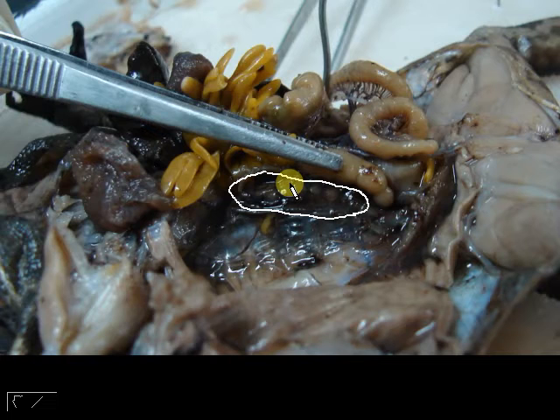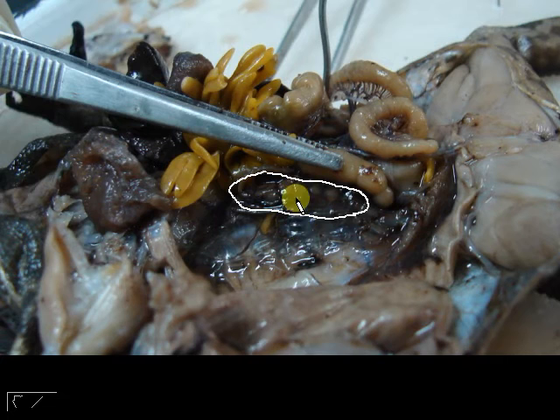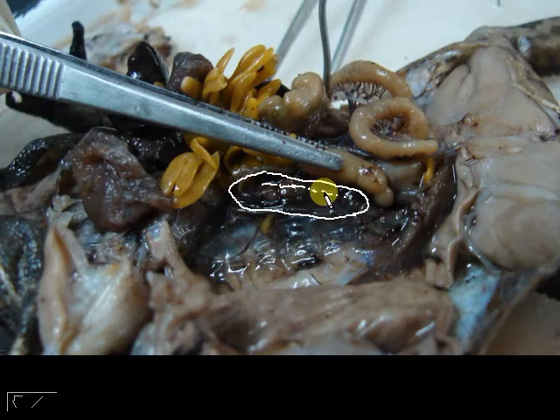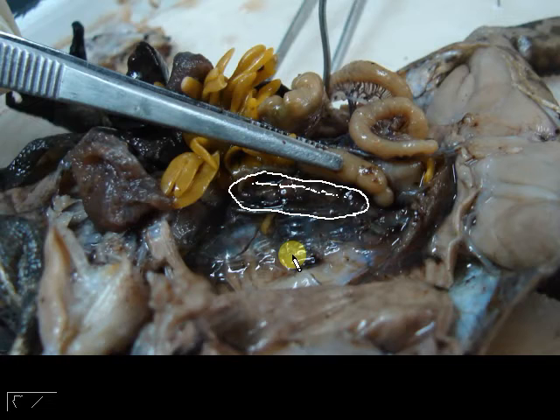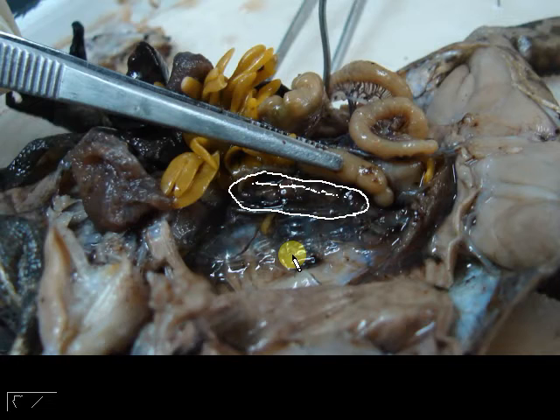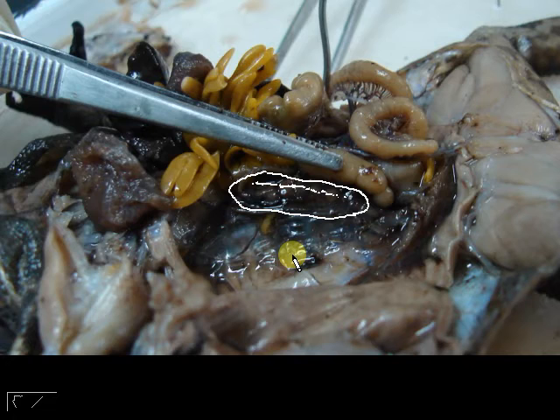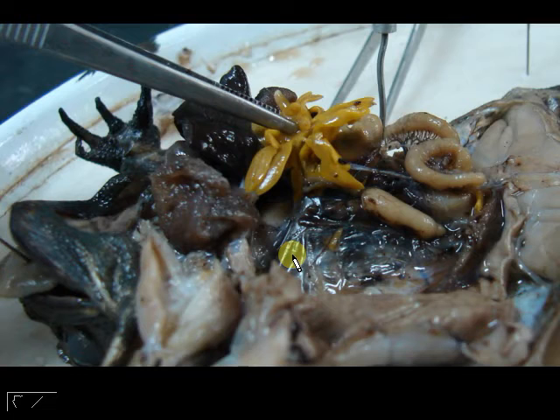That brown sausage-shaped structure right there is your kidney — both sides, one on the right and one on the left. In your freshly dissected toad, you will notice a very thin white-pinkish band sitting on top of the kidney. That is your adrenal gland, which secretes different hormones involved in the fight-or-flight response and also in the regulation of salts and minerals in your body. The kidney filters the blood and secretes the urine, and the urinary bladder stores the urine before it exits through the cloaca.